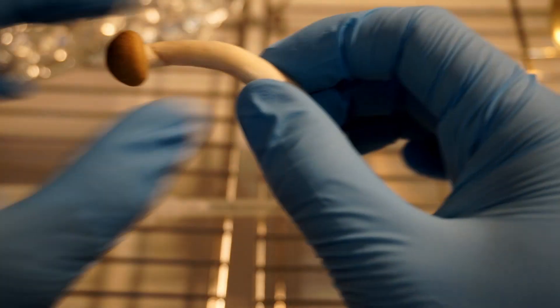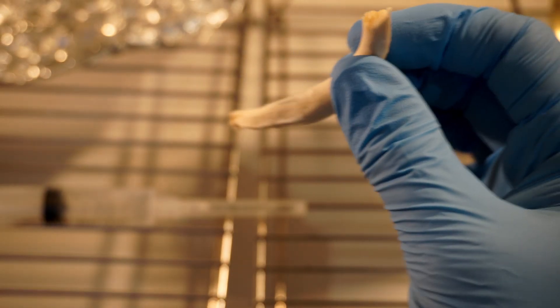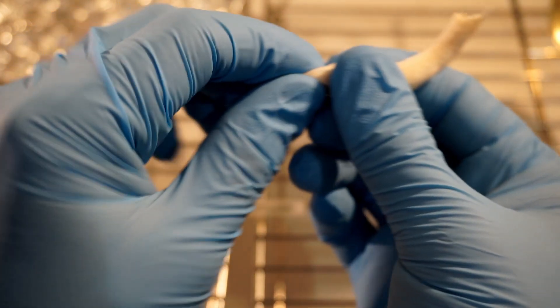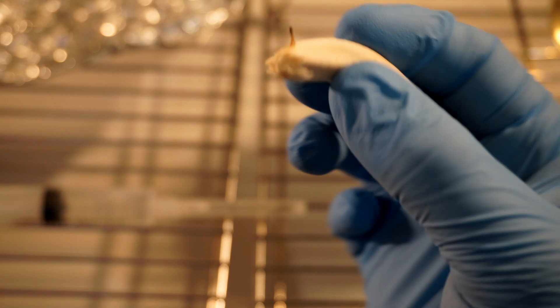One more time you want to pull the cap off and then pull the base off, insert the needle along the filament. You've got to pull it out whilst applying pressure so that the end of the needle cuts the filament.